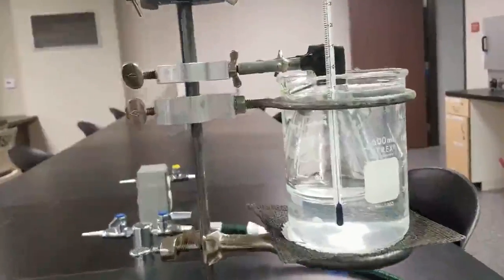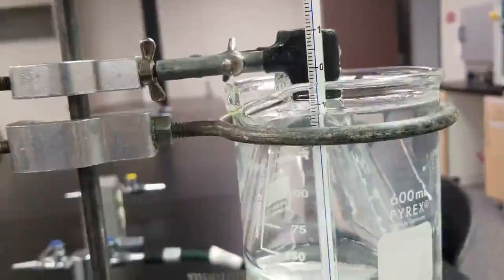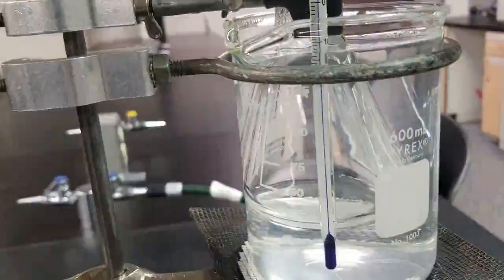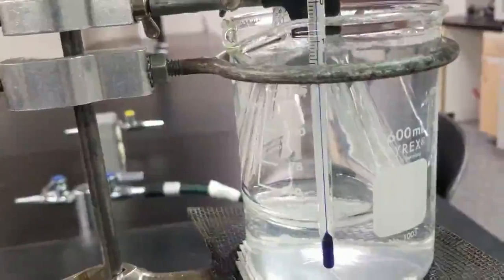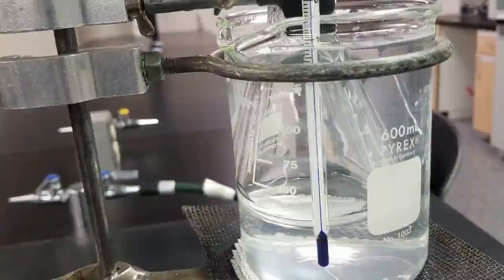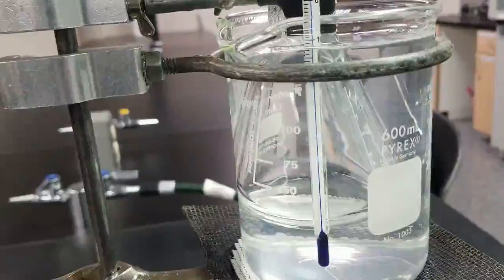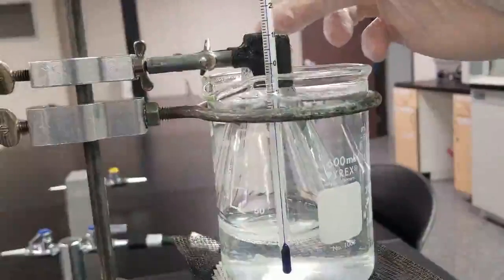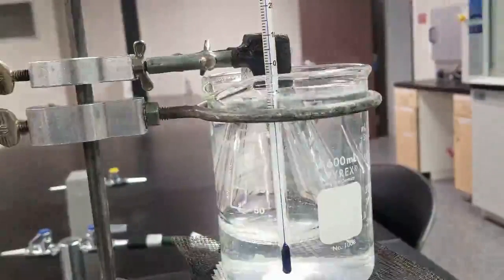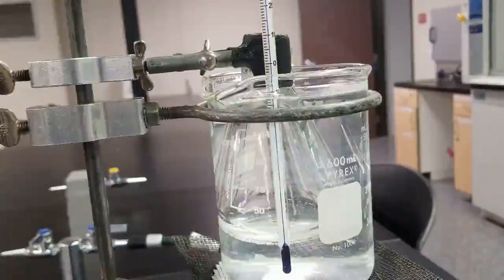And then we're going to watch for all the liquid in the Erlenmeyer to evaporate or boil away. See in the bottom, there's still plenty of liquid in there. We just got started. All right, so at this point, there's no more liquid down here, so we'll give it another about 5 minutes and then take it out and take our recording for measurement.